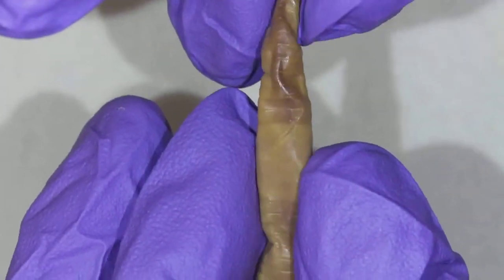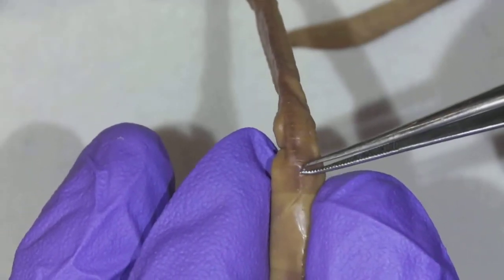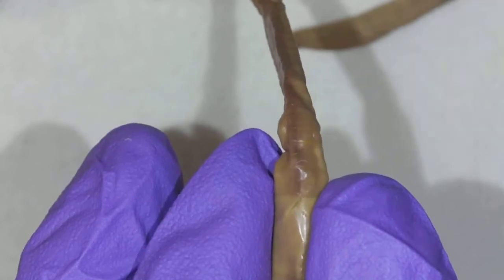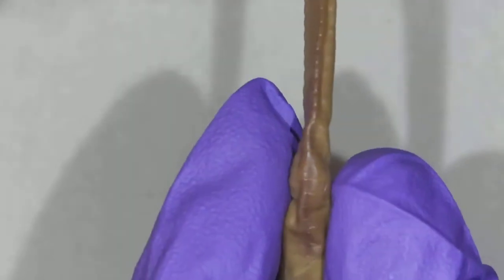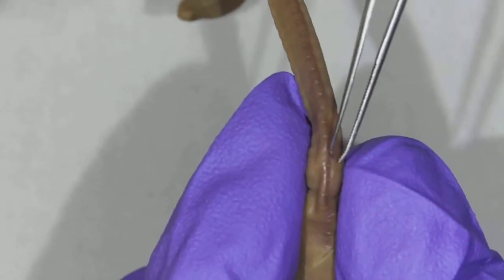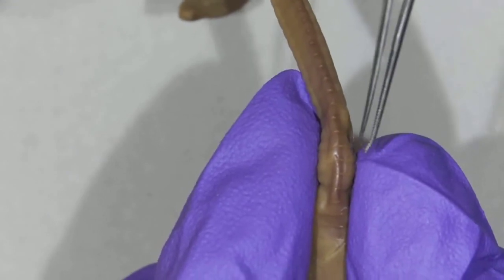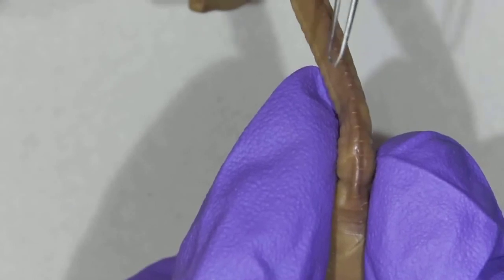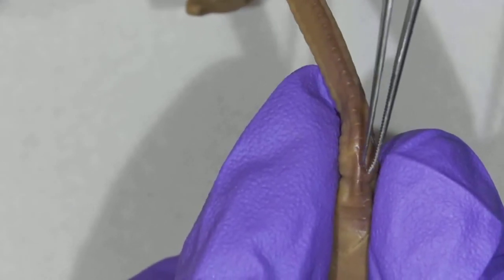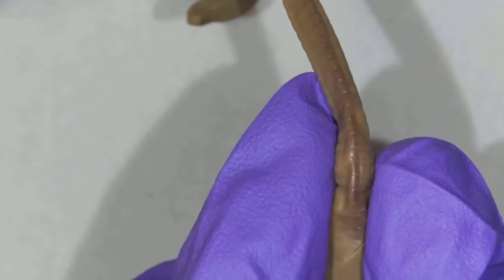All right, now as I move posterior from the clitellum, I start to see this little line right here. A little easier to see as I move down. It's tricky on my preserved worm, but that line right there is the dorsal blood vessel. When I'm dissecting, I want to make sure that I'm cutting on one side or the other because I'd like to be able to see that dorsal blood vessel. It's underneath the skin, and we can just see through the skin to see that. It's going to go all the way down the worm until we get to the other end.